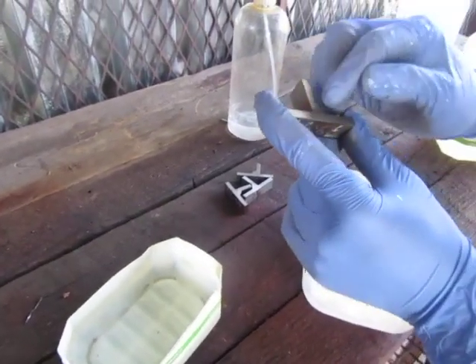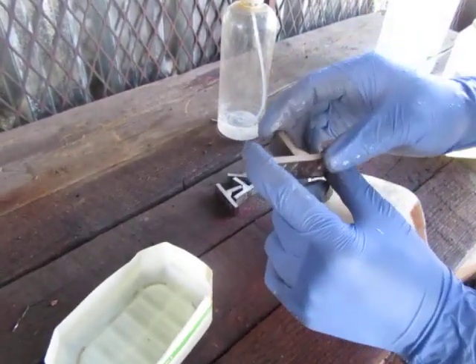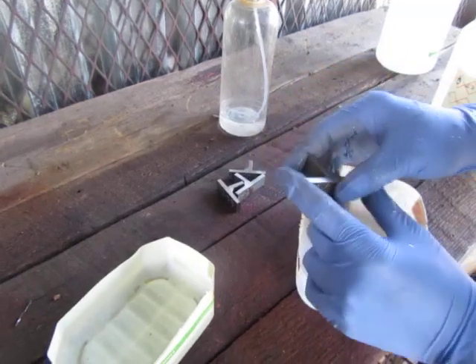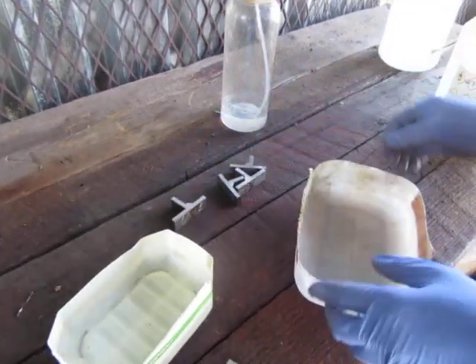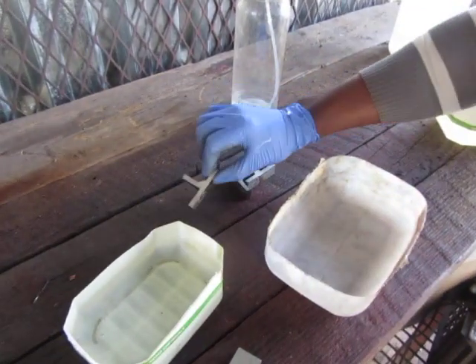In mechanical engineering, we are considering the throat thickness to know how strong the weld is. I want to reveal how the weld looks like after you've welded it and then you want to do some examination.